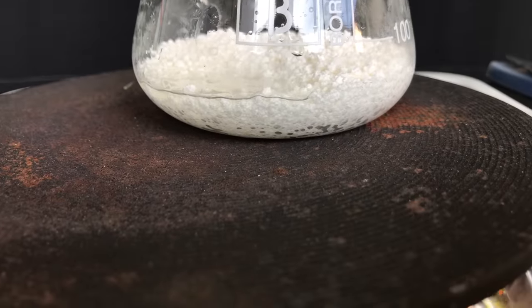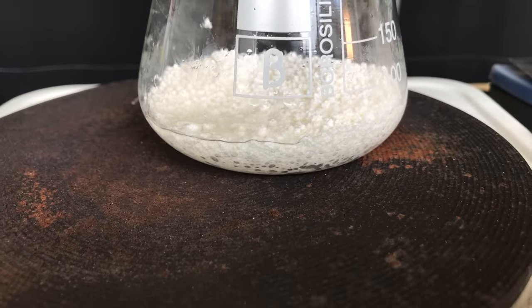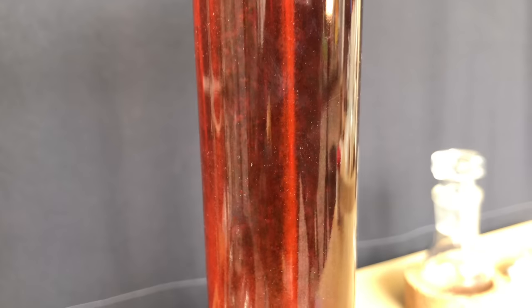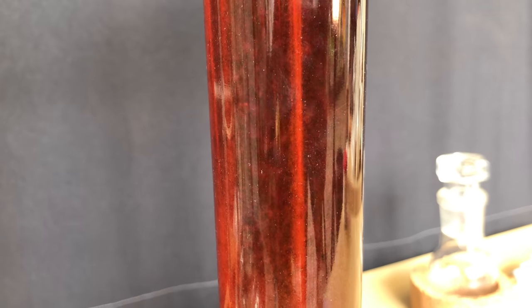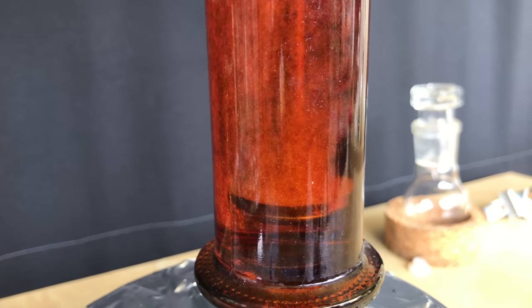Without the help of a hot plate, this method of producing hydrogen chloride would not be viable. Hydrogen chloride was bubbled through our solution for about 30 minutes. As you can see, most of the hydrogen chloride leaves the apparatus without dissolving or reacting. As it is a nasty and corrosive gas, leftovers were let into a canister containing water.